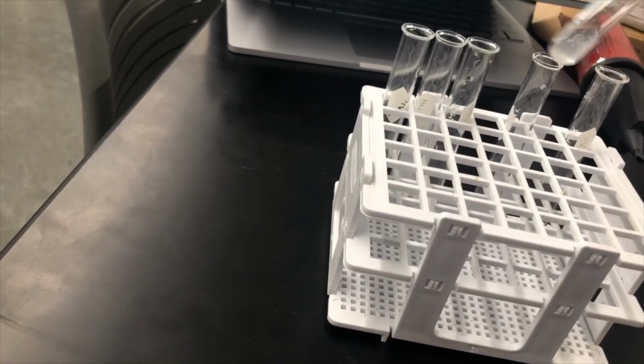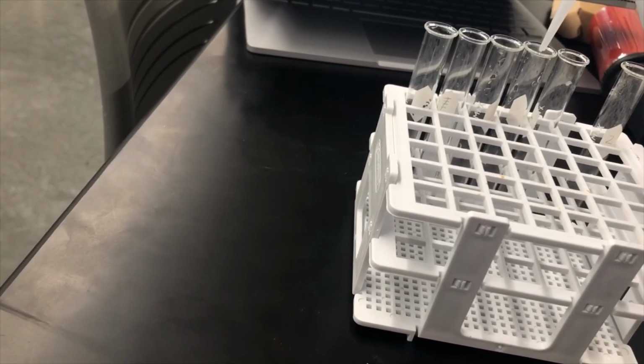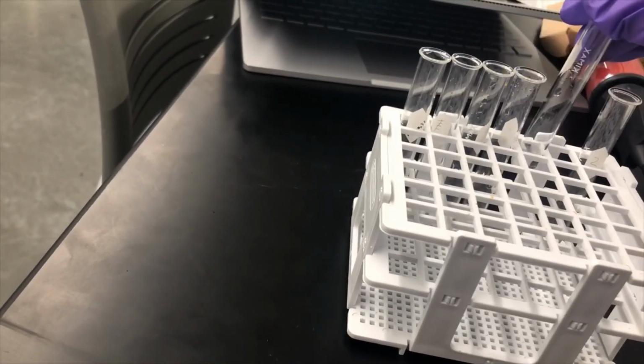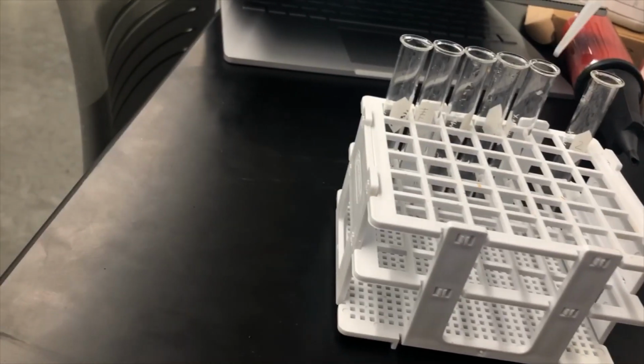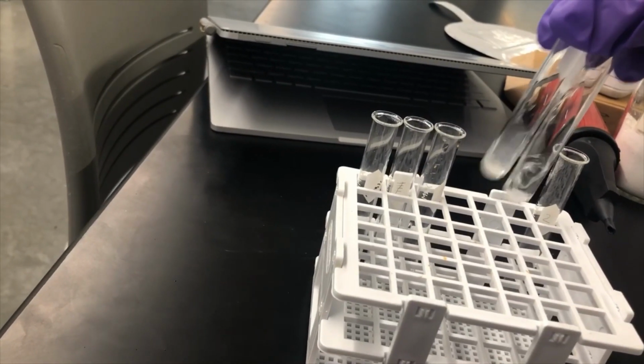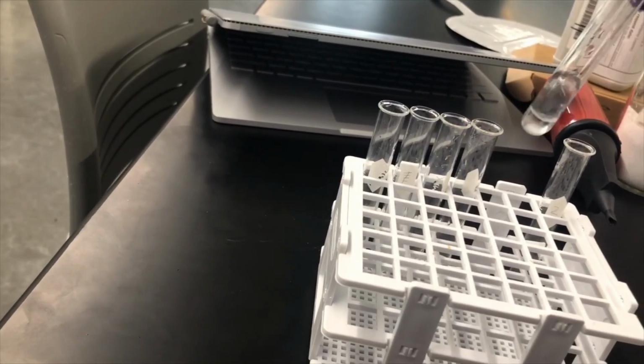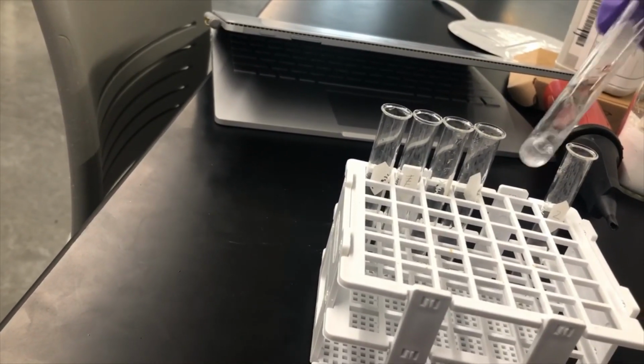So this guy looks like it's trying to dissolve, so I'm going to add a little bit more water just in case I just added too much solid. Same thing for the next, because as you can see for these 2 guys that are definitely insoluble, the solution itself is pretty cloudy. Those guys have pretty clear solutions, which makes me think that they were just saturated, so I had too much solid and not enough water.